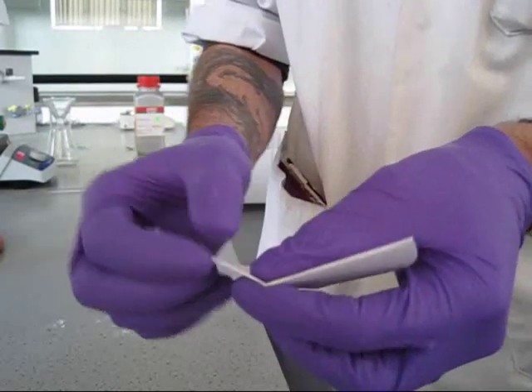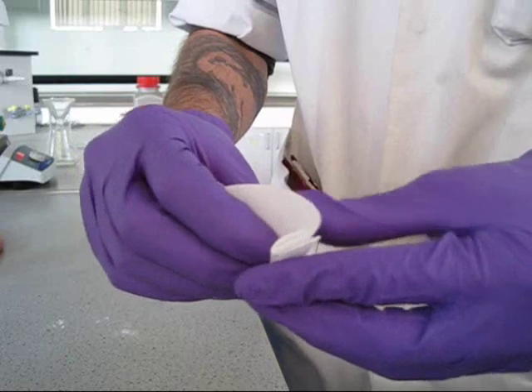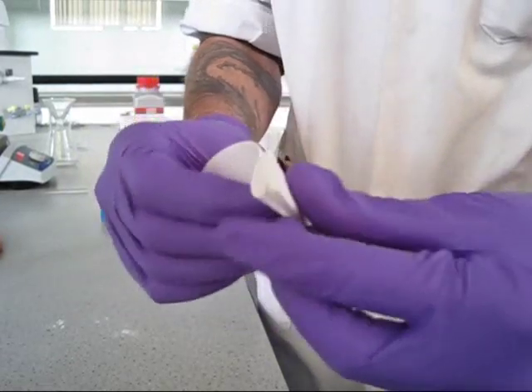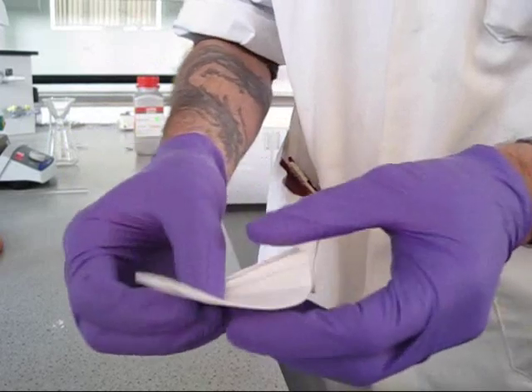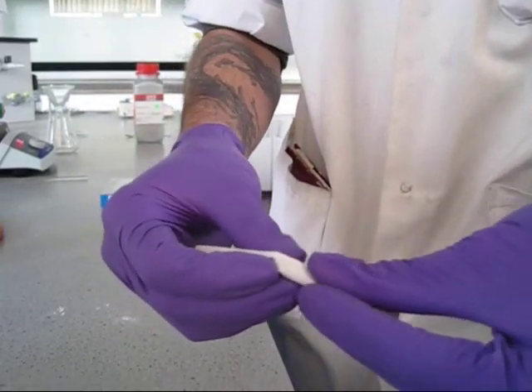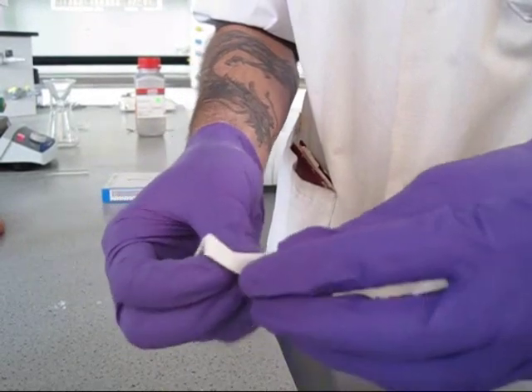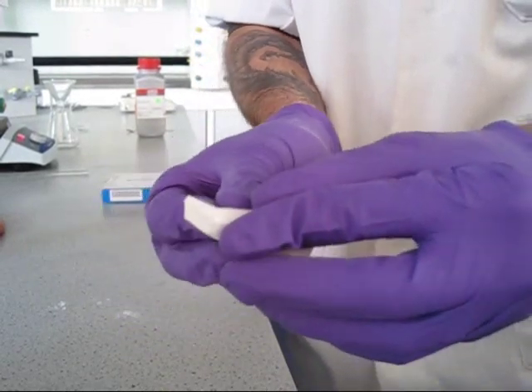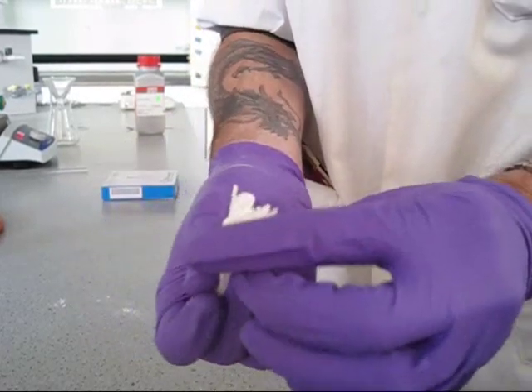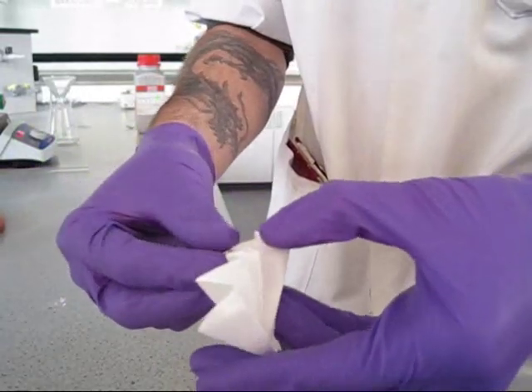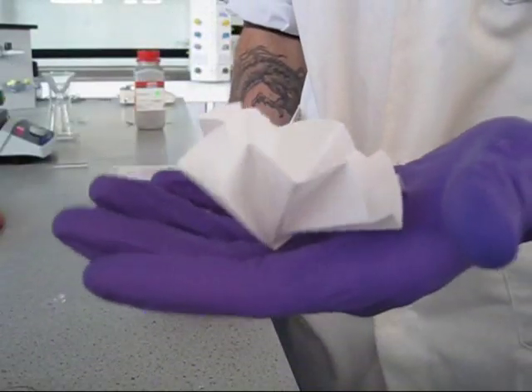Then open it out and start folding the halves into a concertina shape. Do one half, then do the other half. Press it all together, and then open it out. Now you have a fluted filter paper.